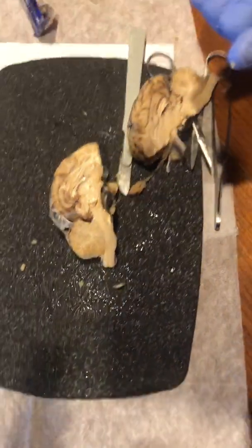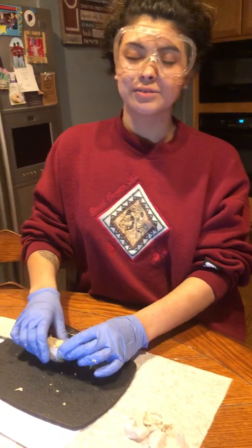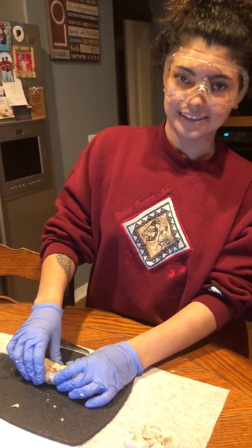Okay, and that right there concludes my week 7 lab exercise with the sheep's brain dissection. Thank you.